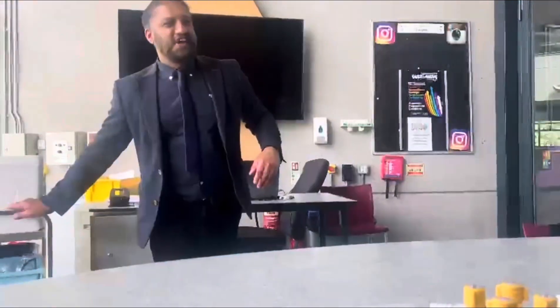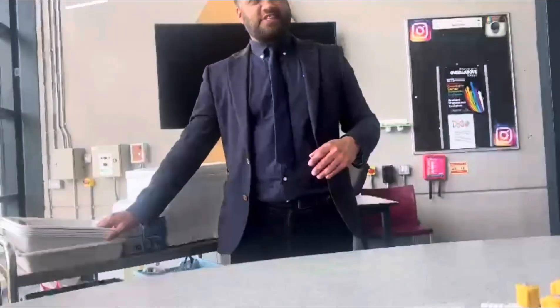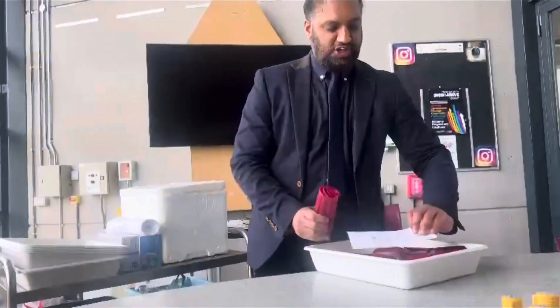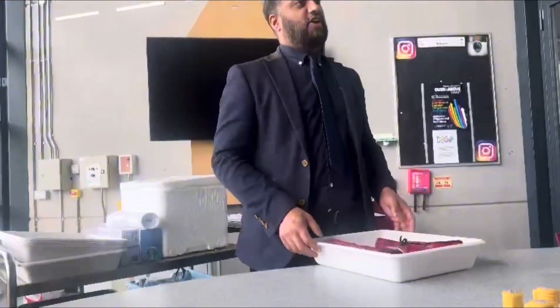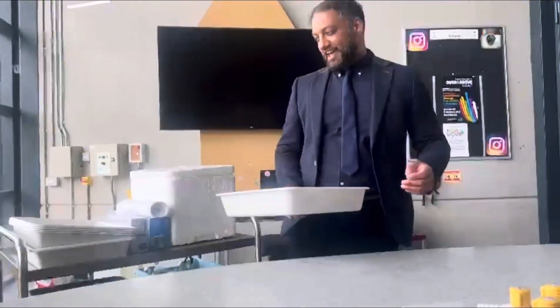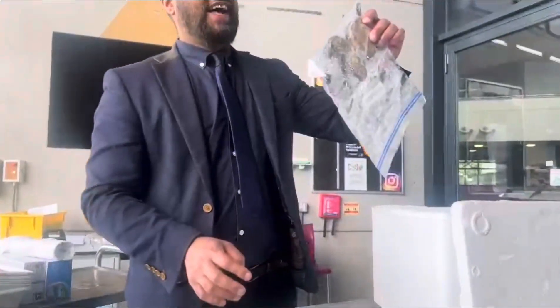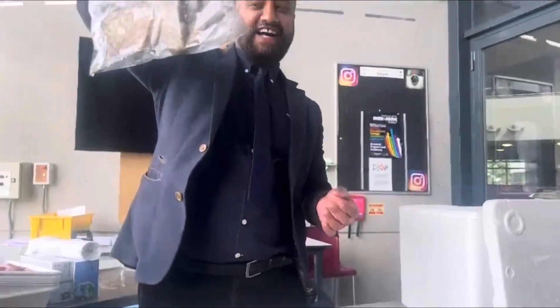Let's go to our class. So firstly I'm going to show you the dissection kit. The dissection kit is there. Everybody's got a dissection kit here. You're going to be working in large groups because we've only got a set amount of them. You've got your aprons there you can wear, and your gloves as well. [Students react:] What the fuck? What is that? It's a frog.